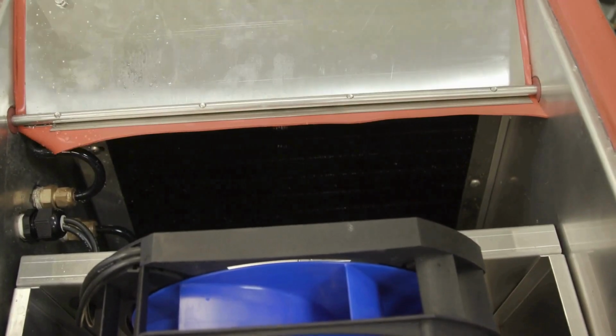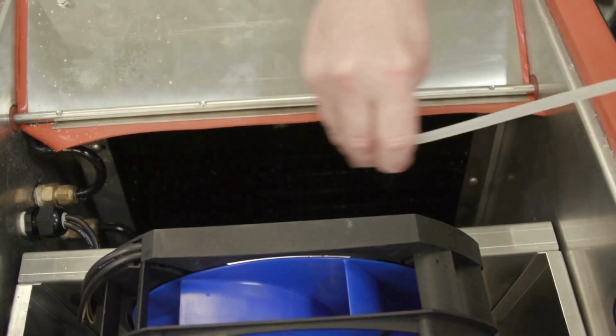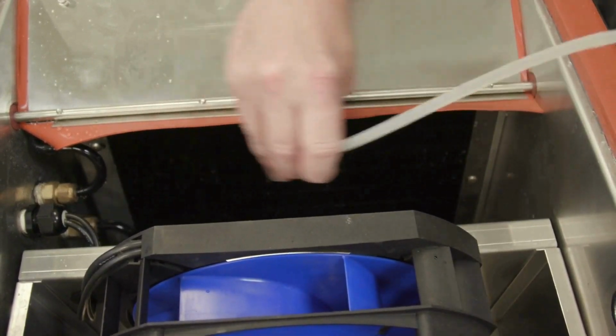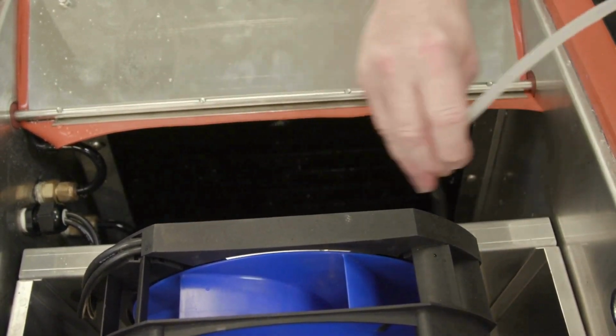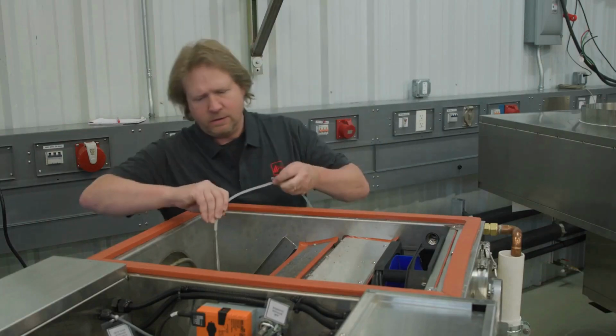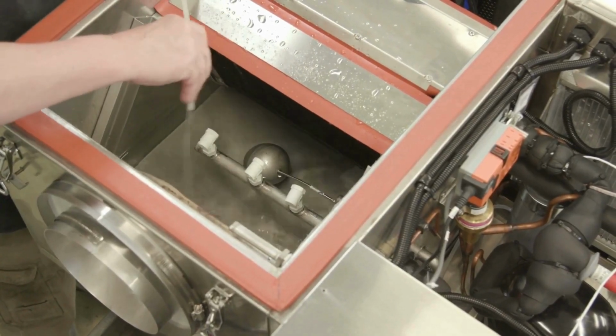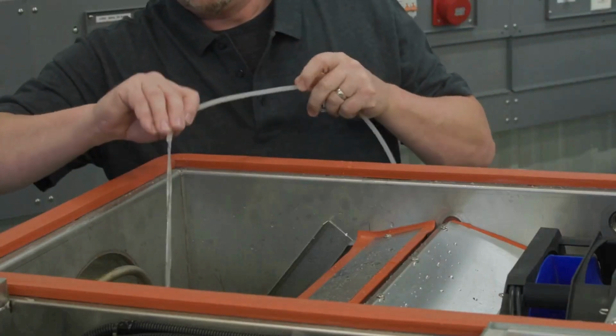Remove the damper and whatever else in order to access the hard to reach side of the coil on vertical units in particular. Be sure to remove the top cover on a coil and clean beneath. Be sure to neutralize any acid used and rinse any cleaning solutions thoroughly. Flush the sump with fresh water.